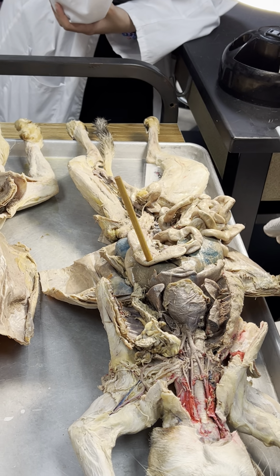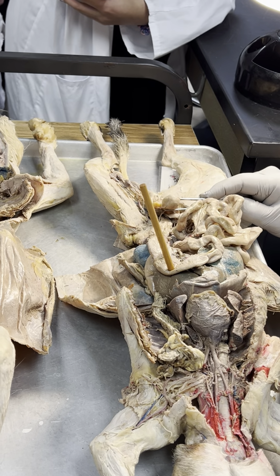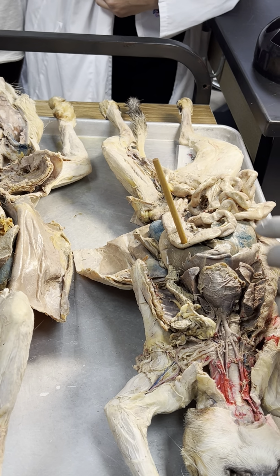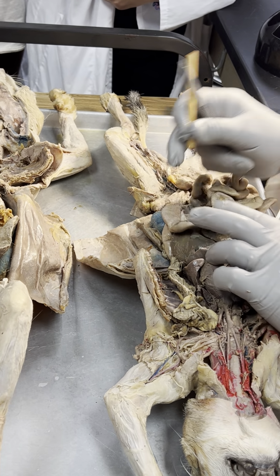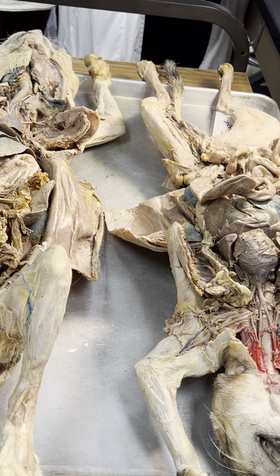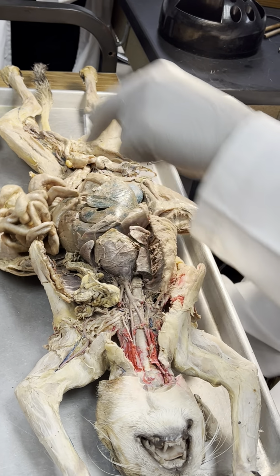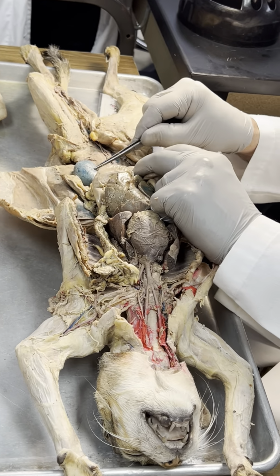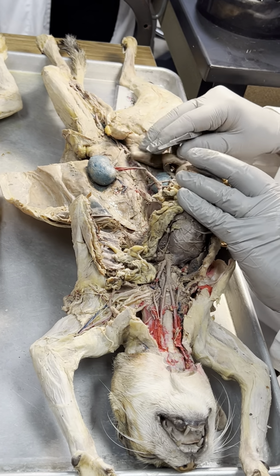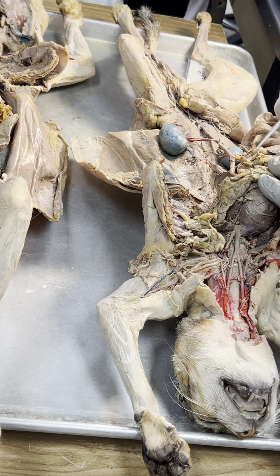And now we got a very different looking urinary bladder. This thing looks like a marble, but that's the urinary bladder. Isn't it supposed to be empty? Why does it look full? It's not empty. And whatever was inside, it's nice and hard. Right kidney, left kidney. There we go. Notice there was no greater omentum on this one either.